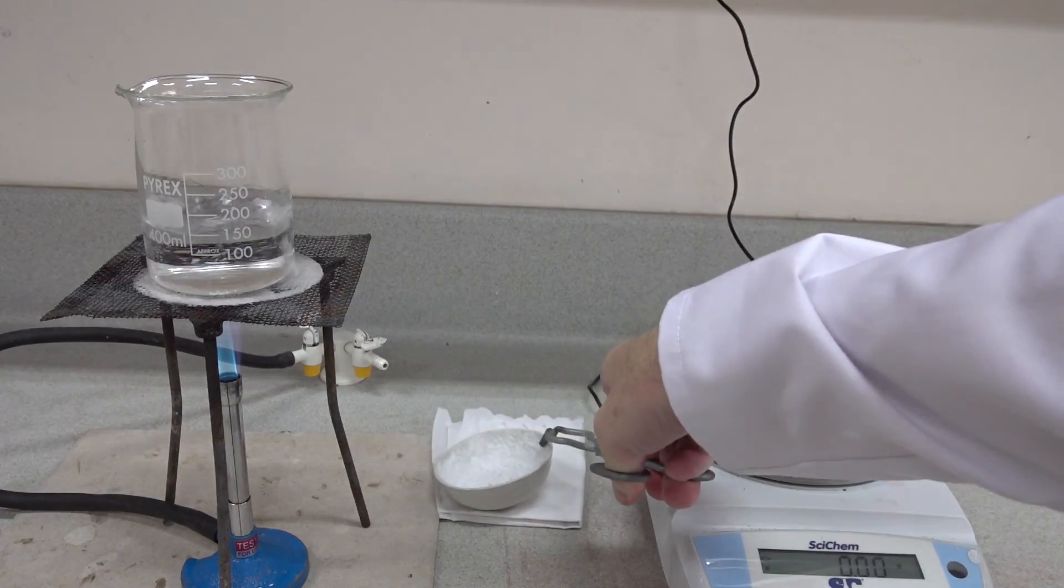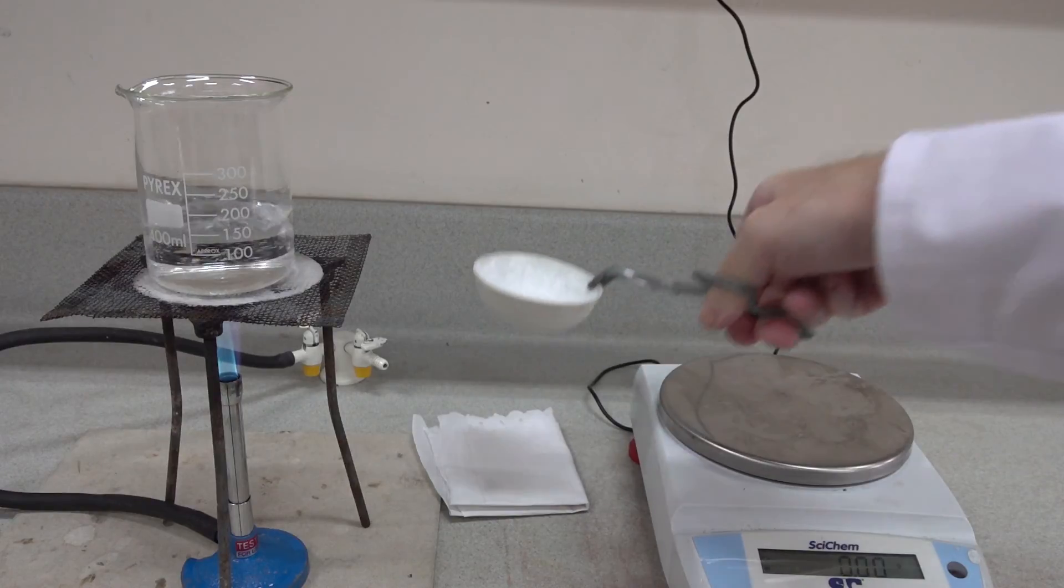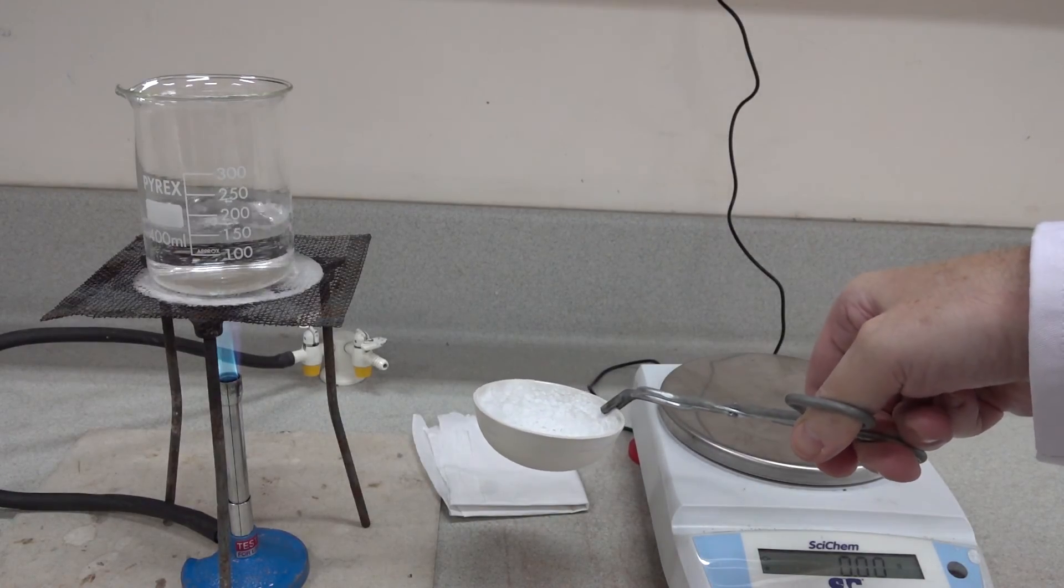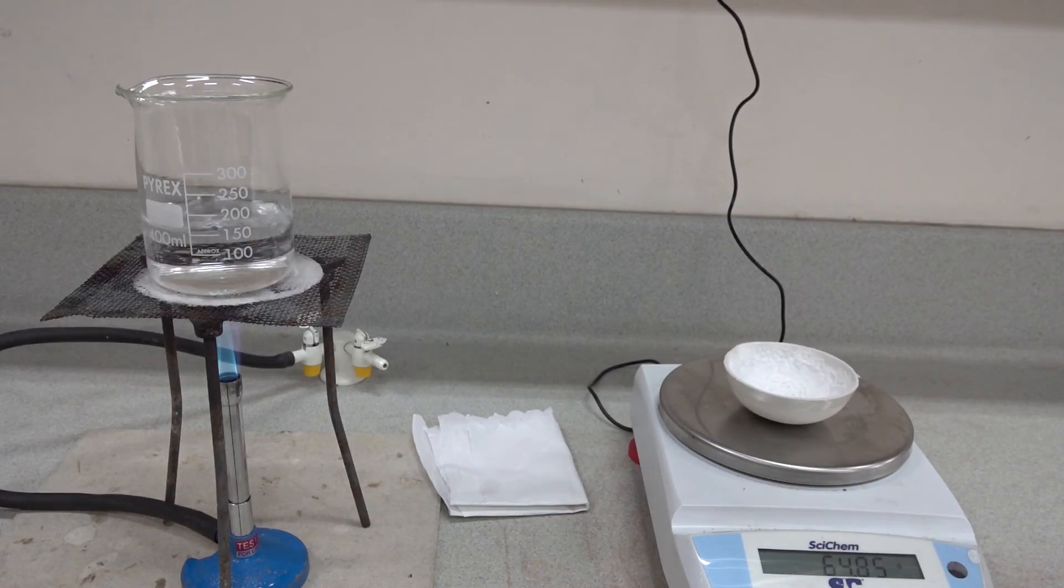As you can see, we'll dab off any trace of water off the bottom, allow that to evaporate, and take a mass reading on the balance: 64.85 grams.